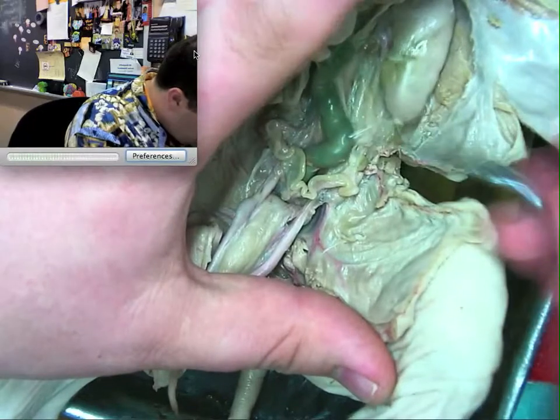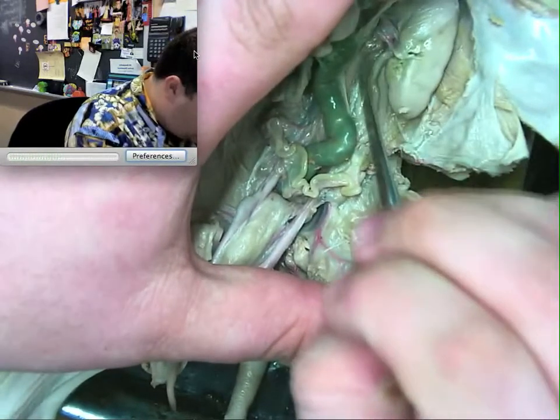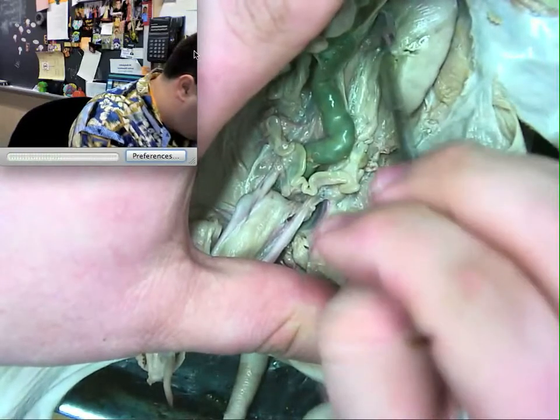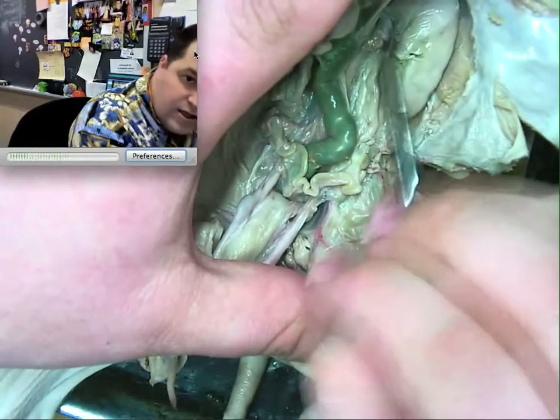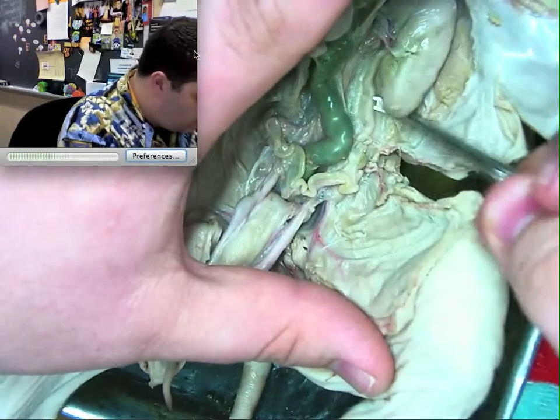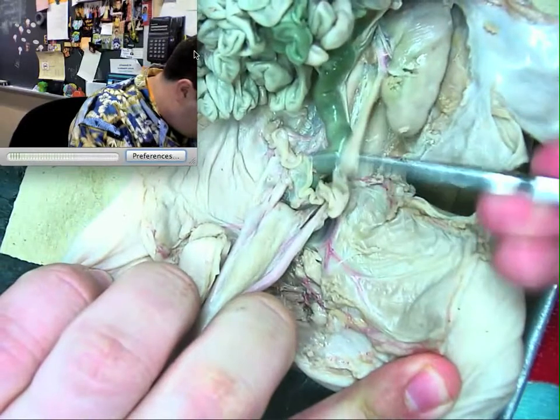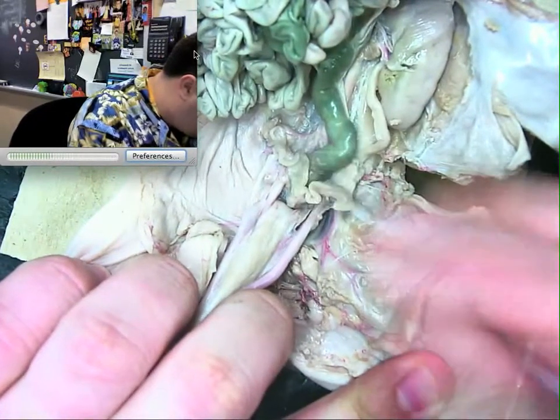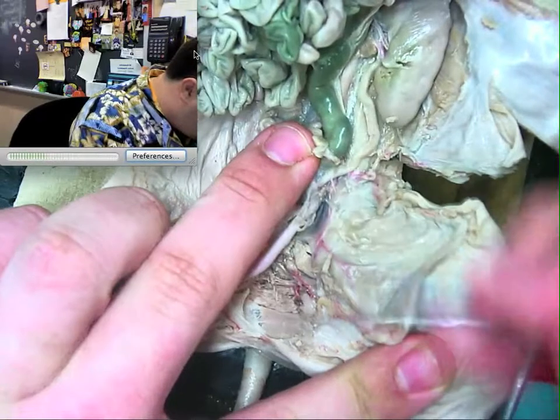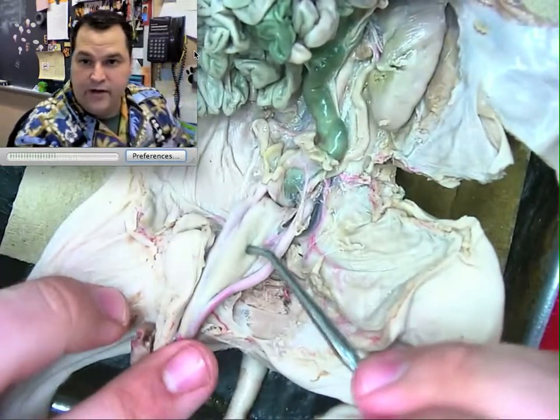Being careful not to hurt the kidney, we can start to see very clearly the ureter. Then we start to see the veins and arteries that innervate the kidney. So we've got the kidney, the renal artery, renal vein, and of course the ureter. The ureter is going to travel downward, moving structures out of the way to see it, and travel right down to the bladder.